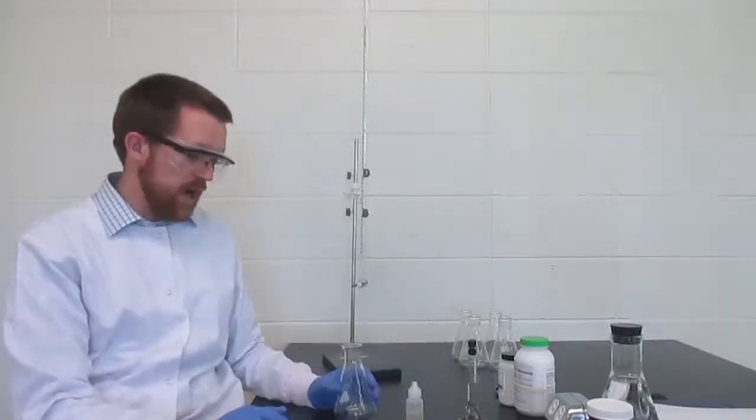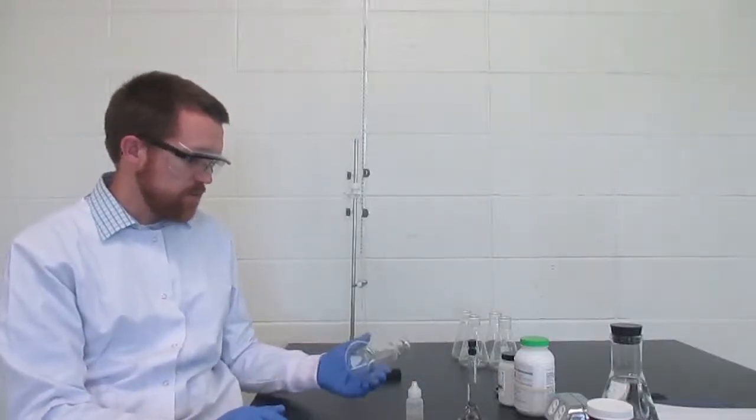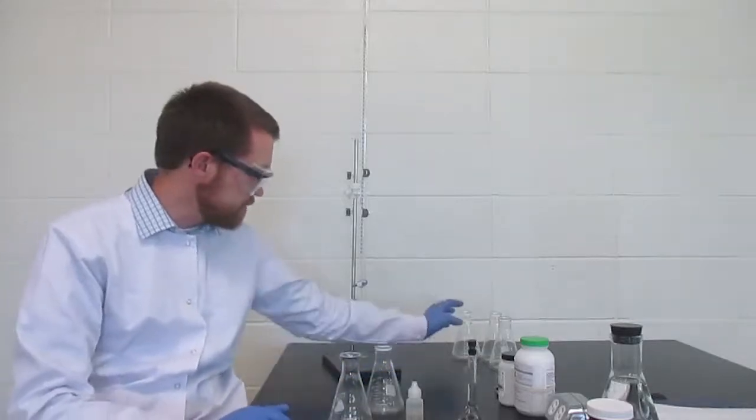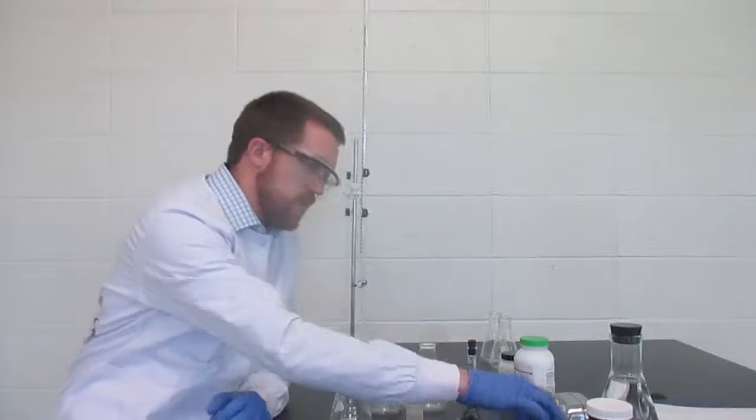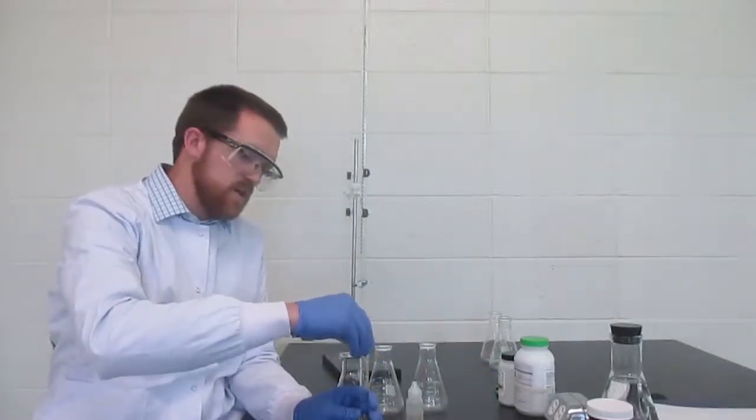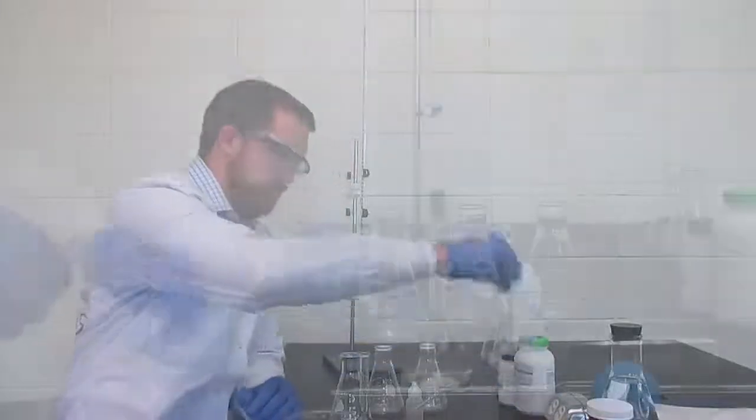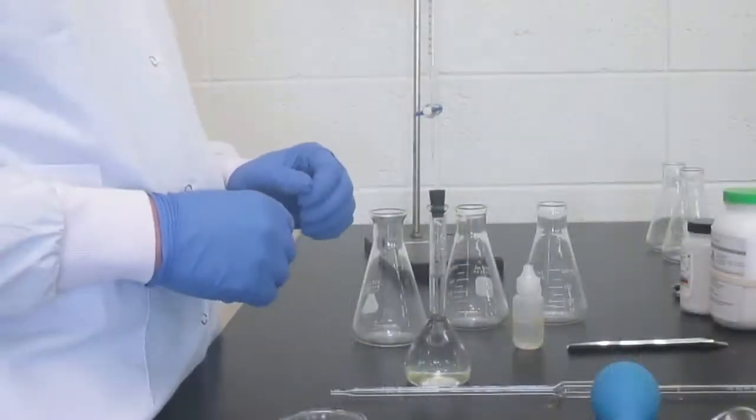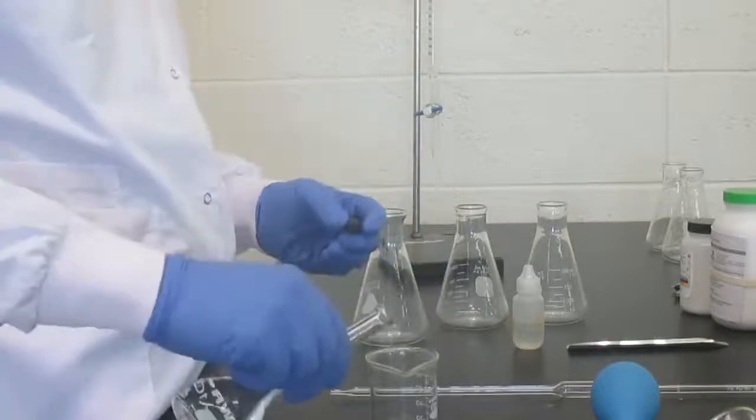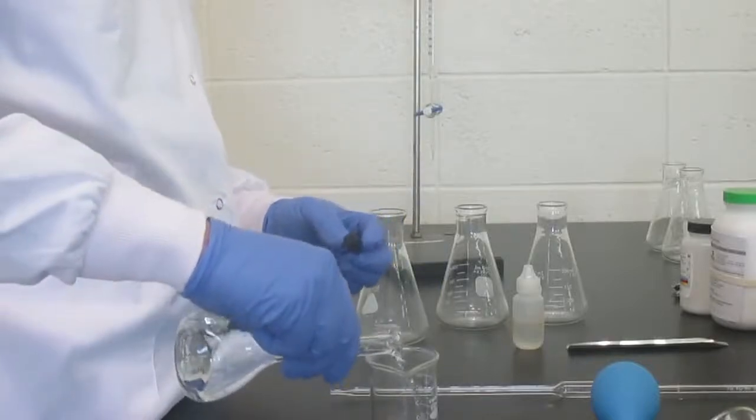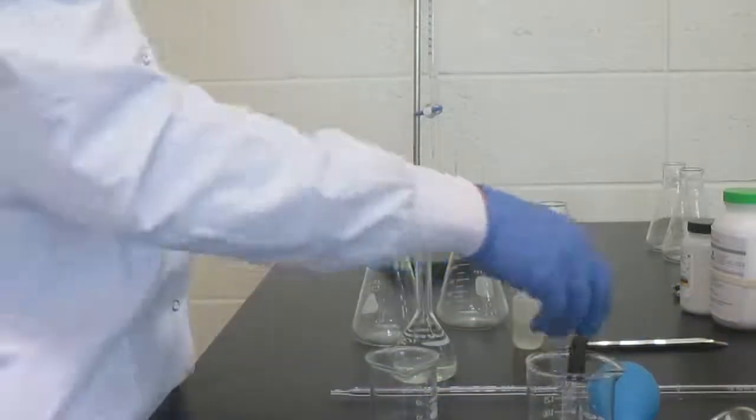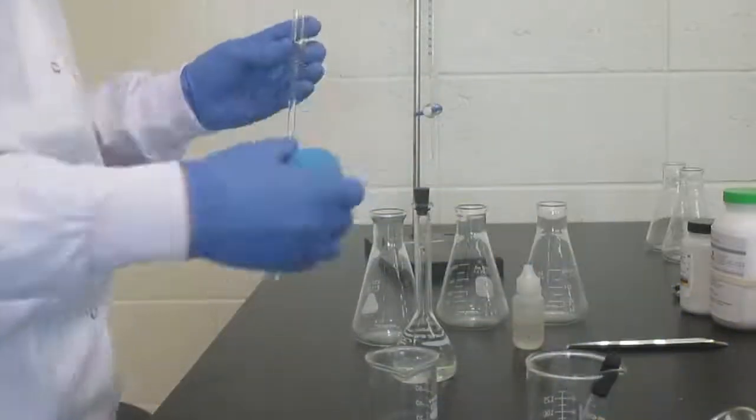We have to put acid as our sample, so we're going to have 10 milliliters of acid. We're going to start off by making three samples because we always do at least three trials of a titration. We may need to do more if we can't get a consistent result after the first three. I'm going to start with pouring a little bit of my KHP into a clean beaker and I'm also going to have a waste beaker handy where I'm just going to put discarded solutions.